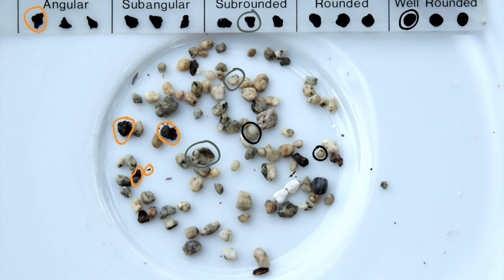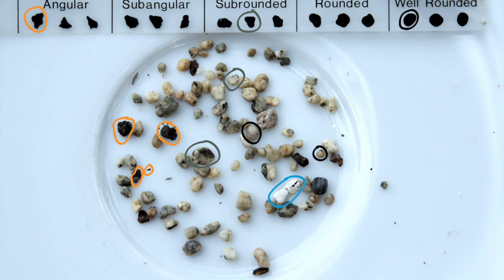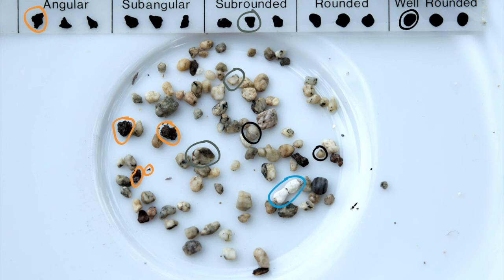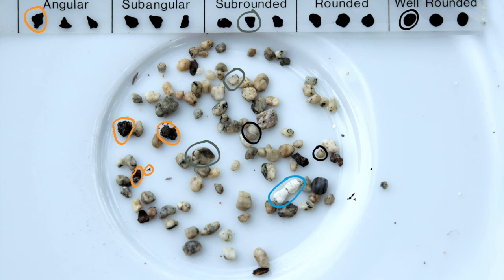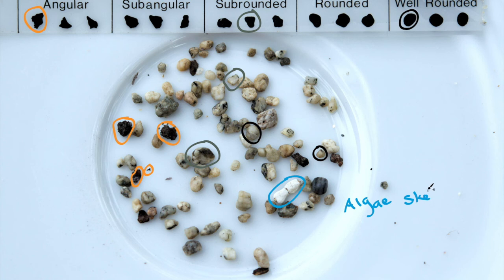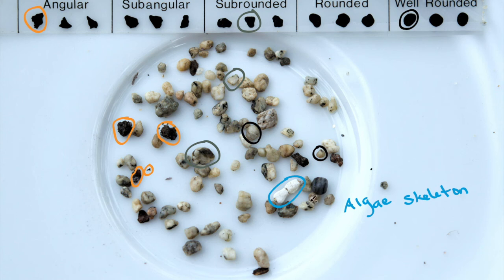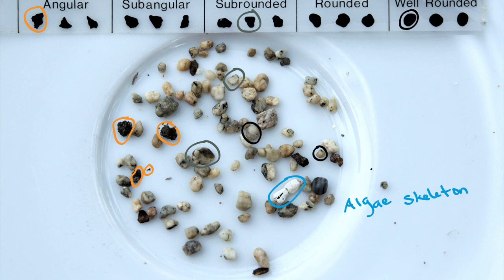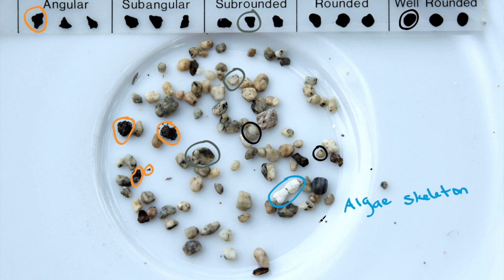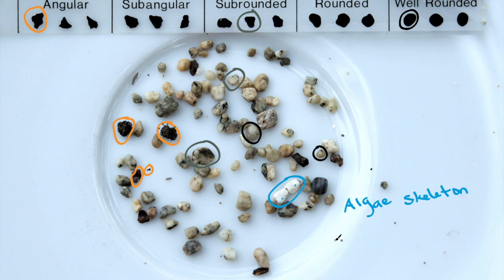I'd like to point out some grains that don't really fit in this pattern — the ones I just circled here in blue. There are two grains and they have the same shape; they're actually connected to each other. These grains are actually fragments of coralline algae — basically algal skeleton fragments. These are often pink if they still have some of the organic matter and pigments from when they were alive. These are coralline algae, and they grow rounded, so in this particular case the grains don't actually tell you much about the transport process. If they had been transported a whole lot, though, these two grains would have broken apart and would be separate.